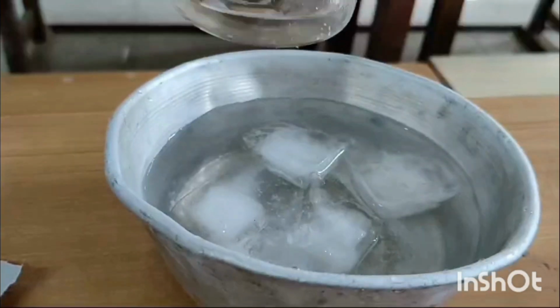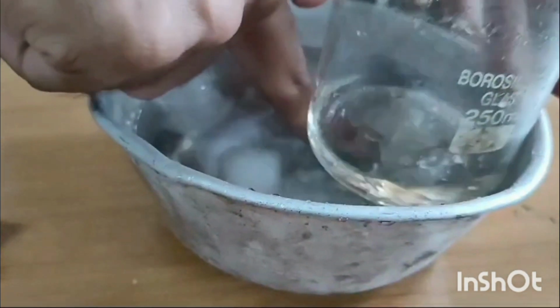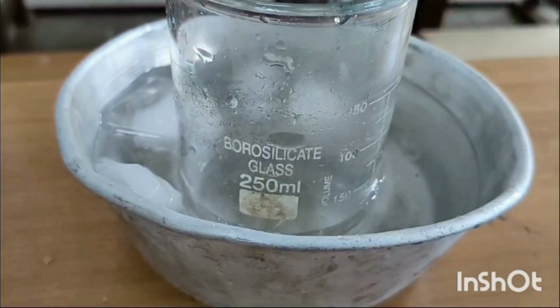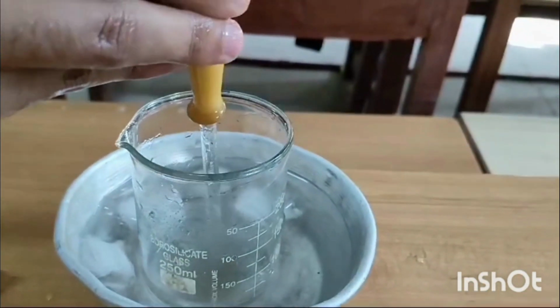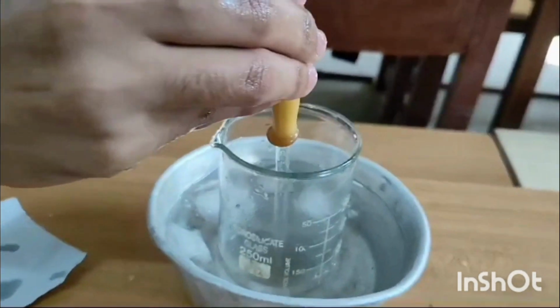And now we have to keep this mixture in an ice bath having some ice cubes in it so that sufficient lowering of temperature and cooling takes place. We have to keep it in the ice bath for about 10 to 15 minutes, and meanwhile we have to add concentrated sulfuric acid with the help of a dropper in a dropwise manner.